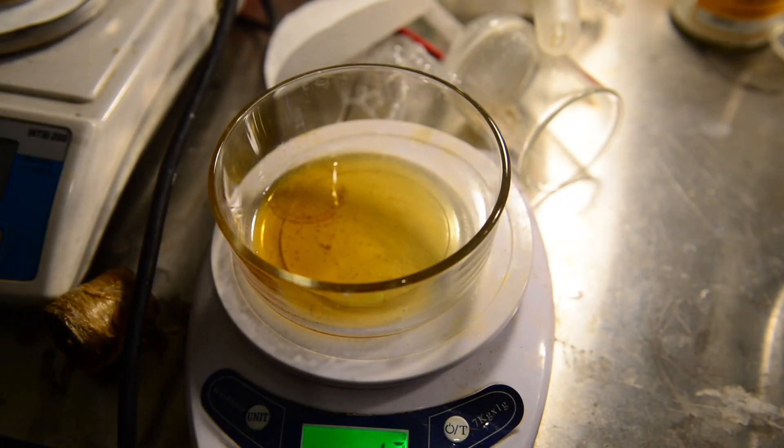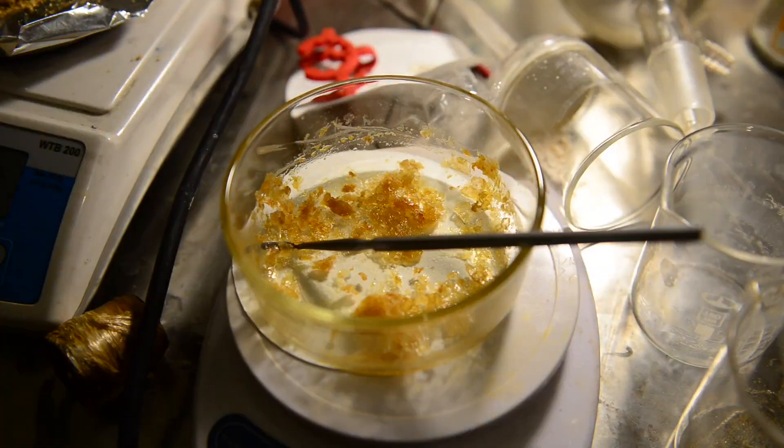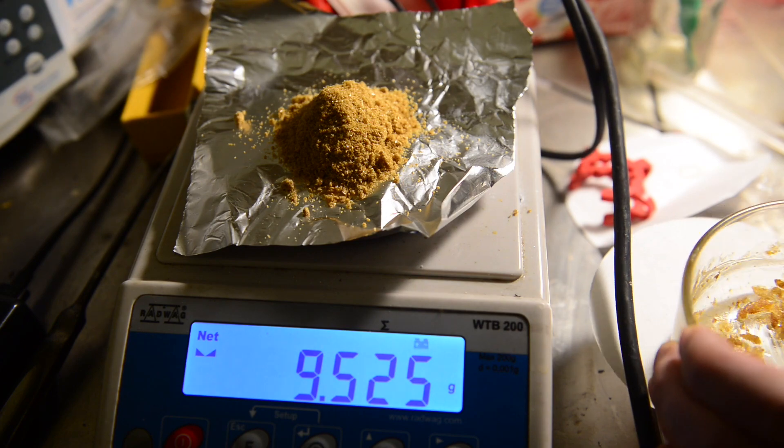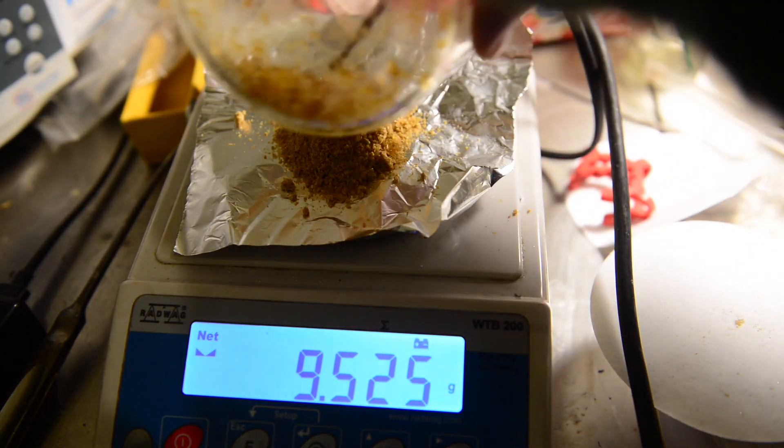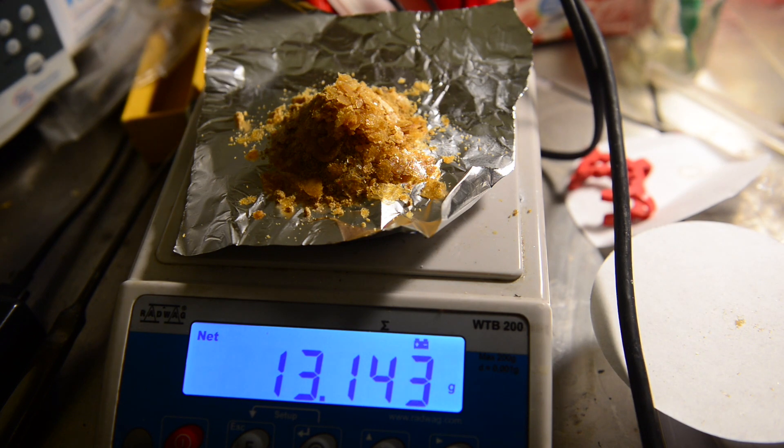After stripping off the solvent I have placed the leftover liquid to the crystallization dish. Very soon liquid solidifies with crystals. Combined crude yield is 13.635 grams which represents 78% of the theory.